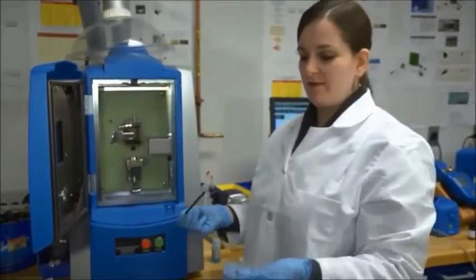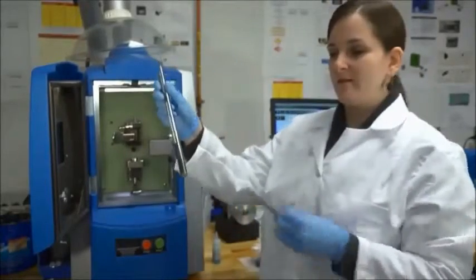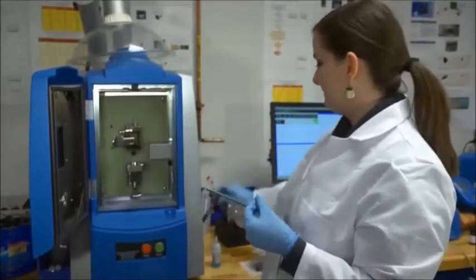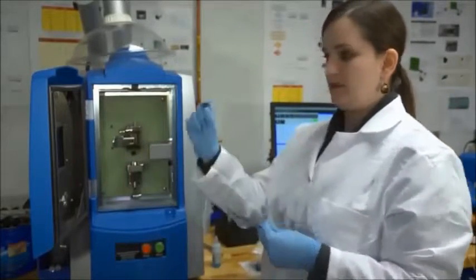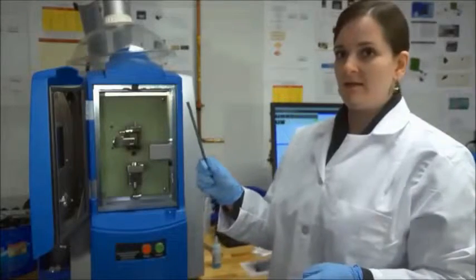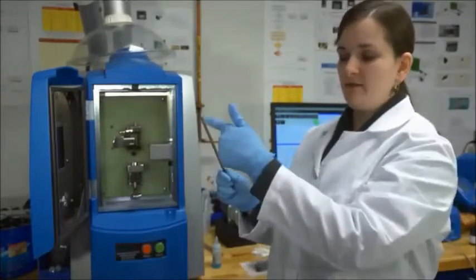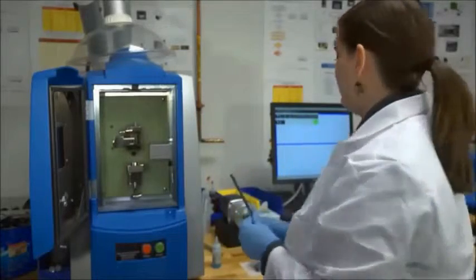In terms of consumables, you have your disc. You'll need a new disc every time. And your rods. You can use one rod several times. You clean and sharpen the end between each use.